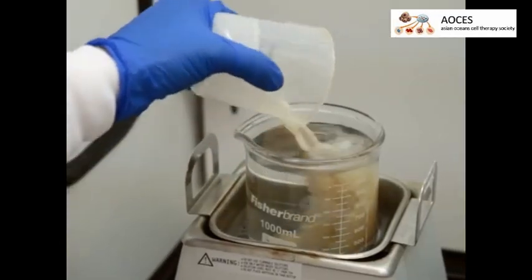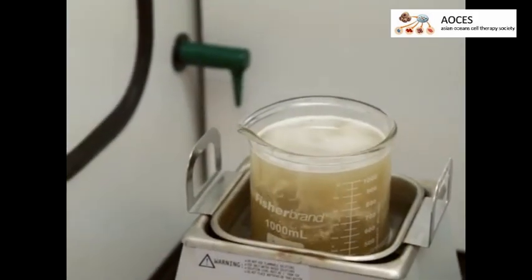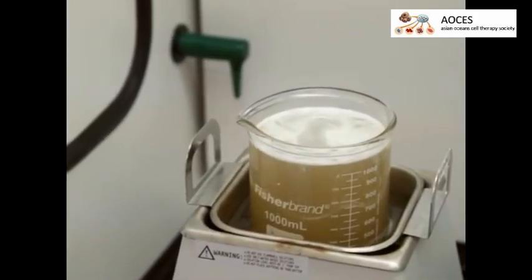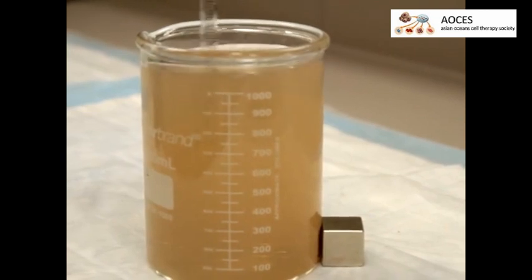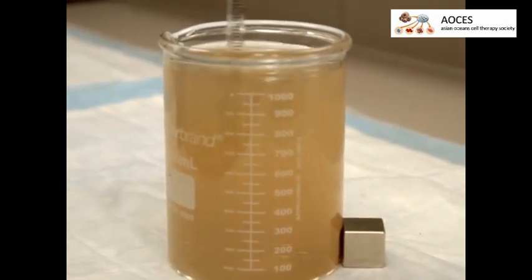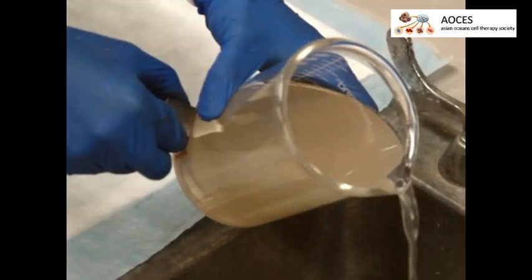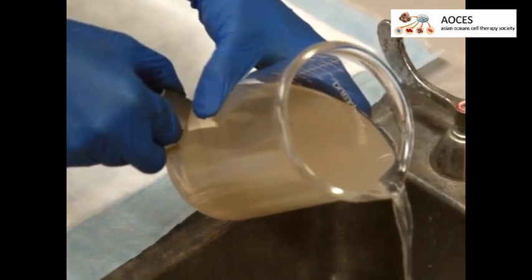Dilute the solution with 1 liter of deionized water and sonicate in a fume hood for an hour. Then place a strong magnet next to the solution and gently stir the solution to collect the spions at the magnet. Decant the aqueous solution while retaining the spions in the beaker.